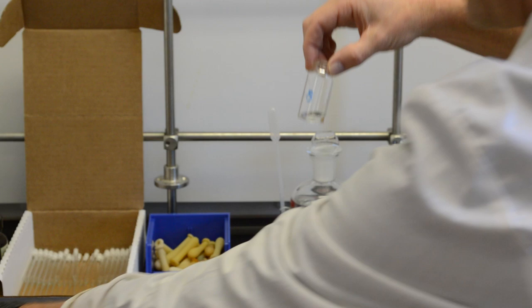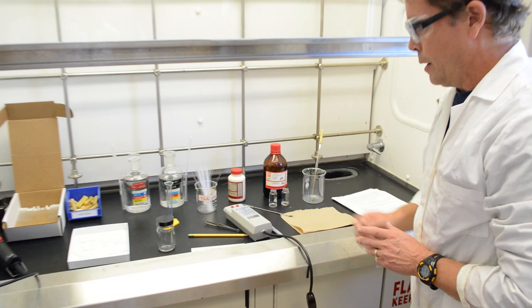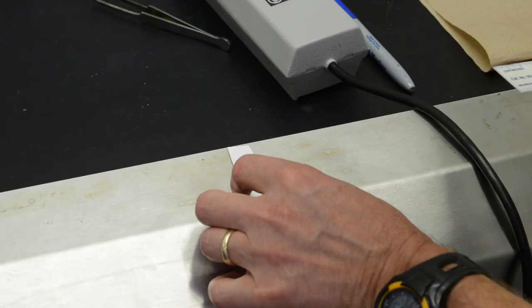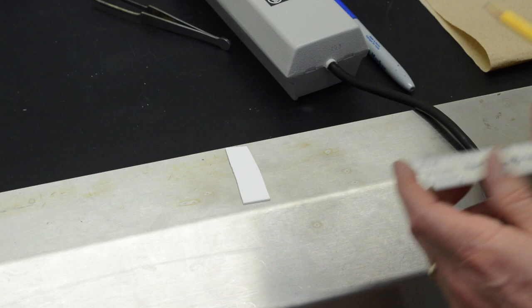Now, TLC preparation. We grab a plate, making sure we don't put our fingers on the silica gel side of the plate. There's a glass side and a silica side. To prepare the TLC plate, we will put a faint pencil line about three quarters of a centimeter up from the bottom of the plate.